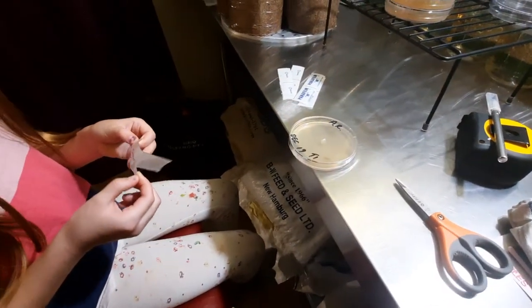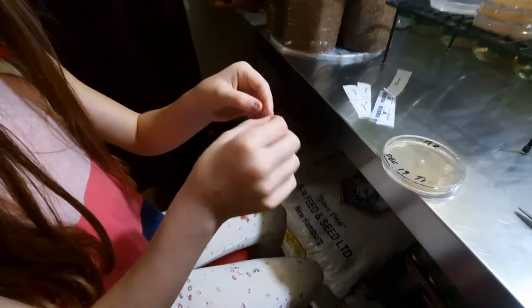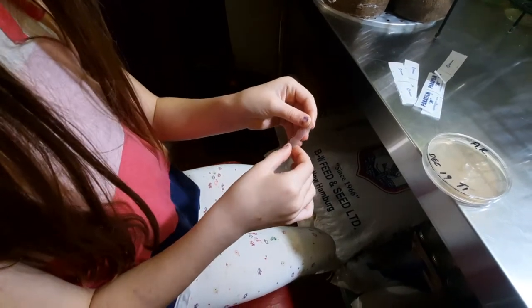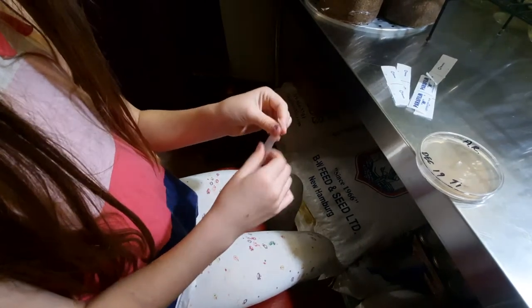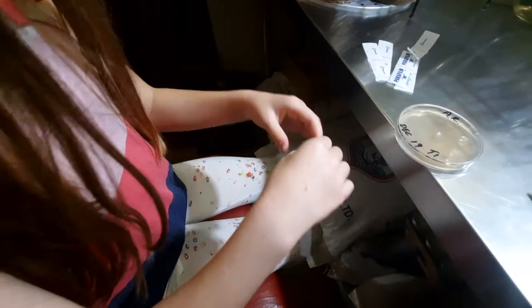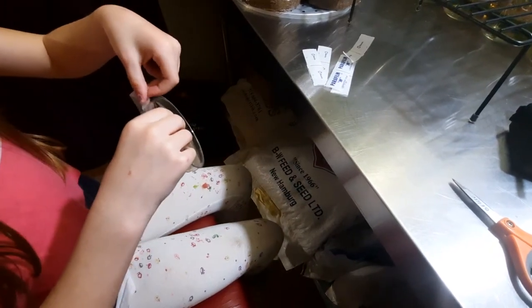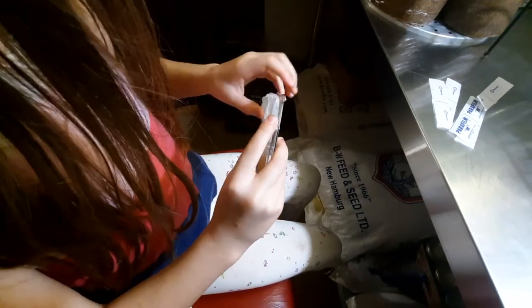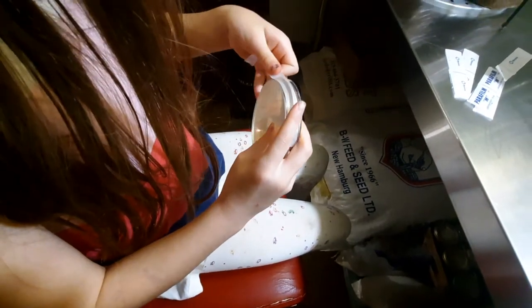Ready? Show us who's the man. You open it like this. Then you fold it in half. What's your secret to doing this part? Then you stretch it. Then you carefully pick up the plate and you stick this on. Very carefully. And then you add this on. Oh, that part you have to stretch. There we go. And stretch.